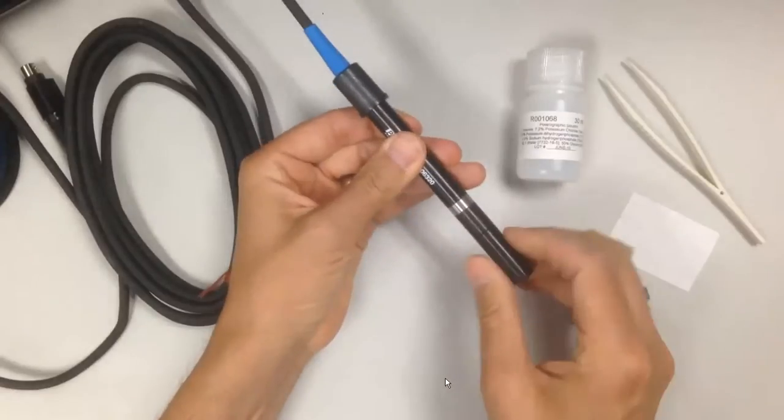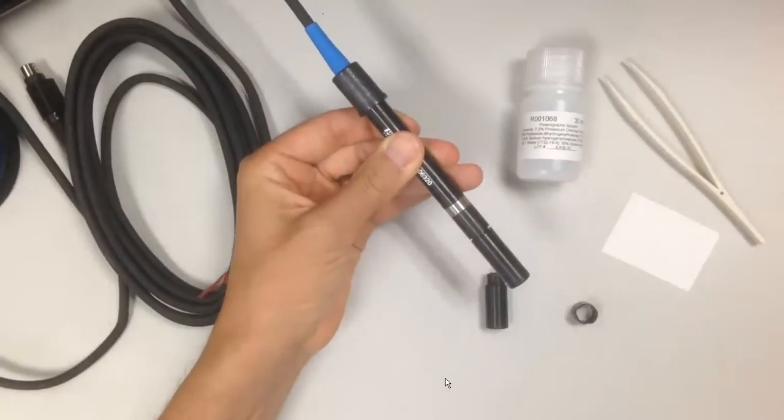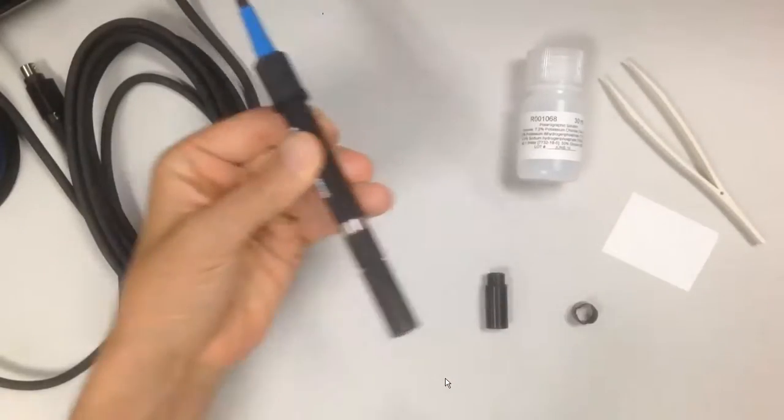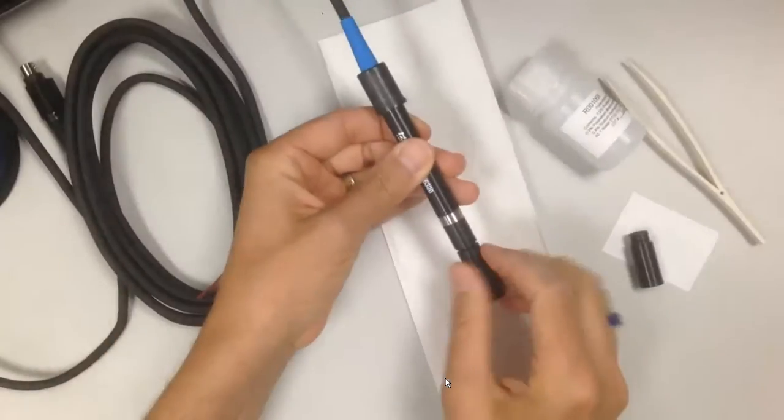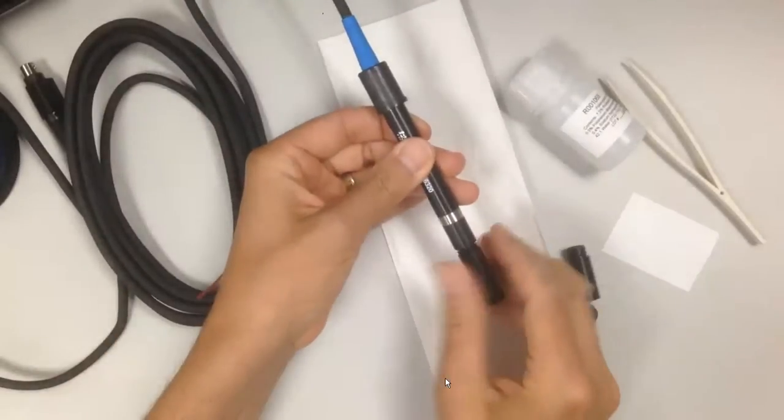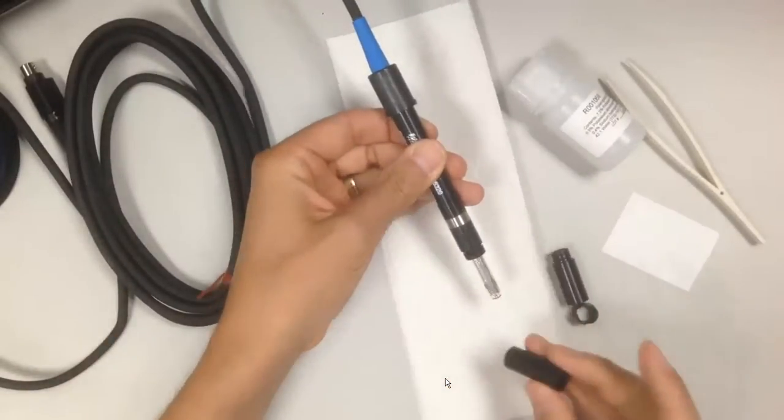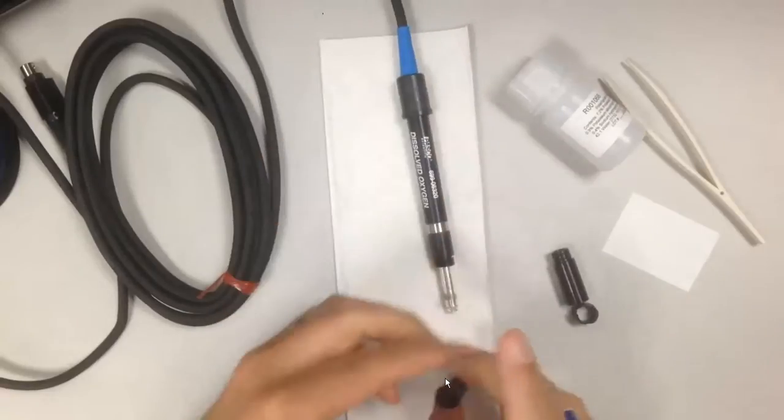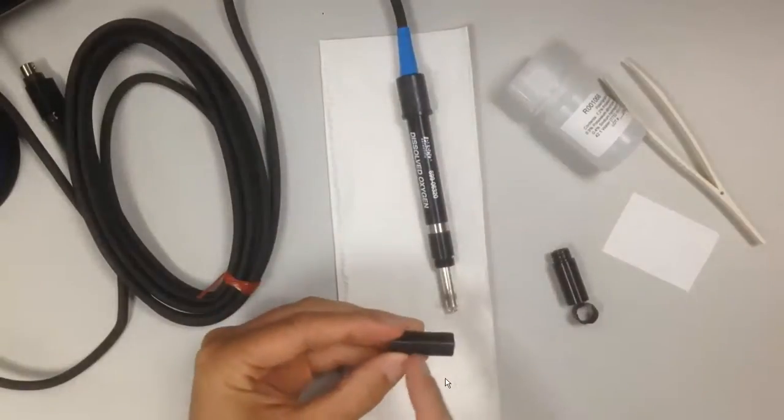First, grasping the top of the probe and loosening the top of the original probe. Place this over the paper towel as this may or may not leak depending if it's filled with solution. The solution has been removed from this probe head for this demonstration.